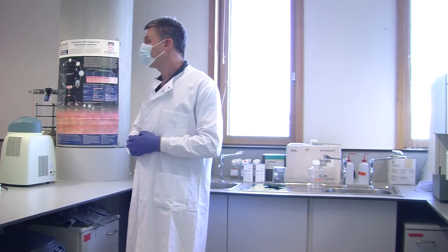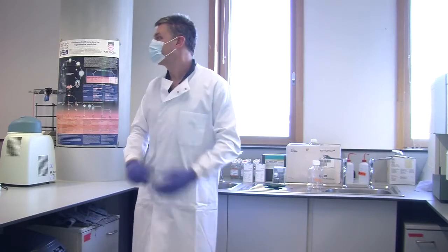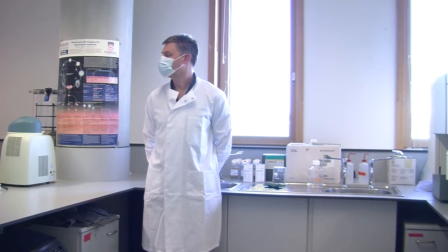Good. Right. Okay, are we ready? And here we are, ready. So we have done the first step of the experiment. What we think we need to do now, we have all the samples, is just centrifuge the samples, all of them. And after, what you need to do is start in step 2, where you would resuspend them with 500 microliters of fixation buffer. Okay? So we have done the cell counting for you. That is sorted. We will just need to do calculations when we have your report, okay? But we will do those after.